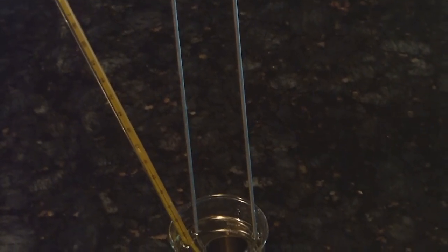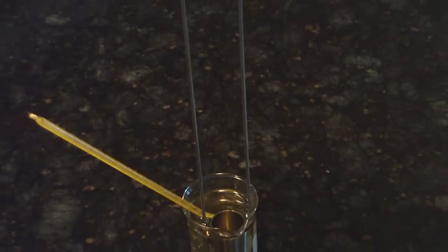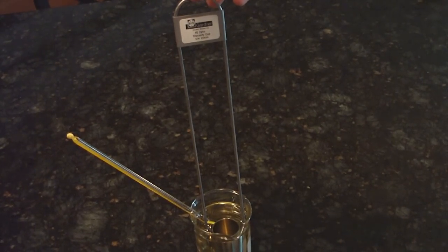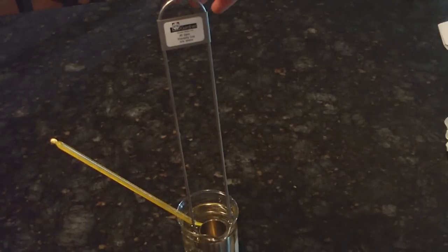And now it is time to measure the efflux time with the Zahn Cup. Lift the cup out of the container, allowing the cup to hang vertically from your finger by means of the ring.